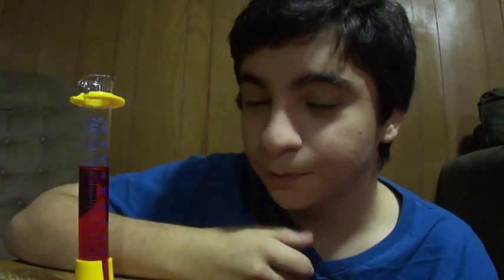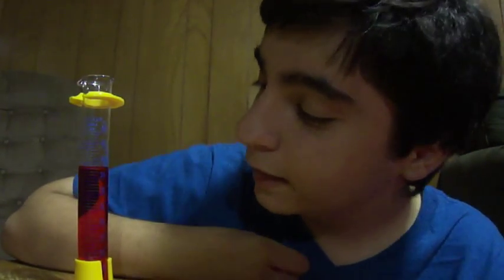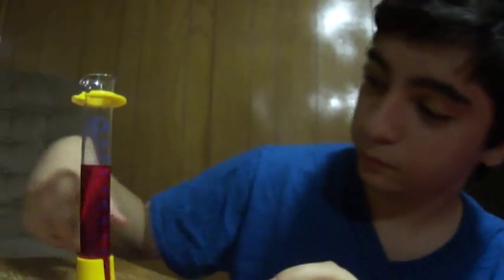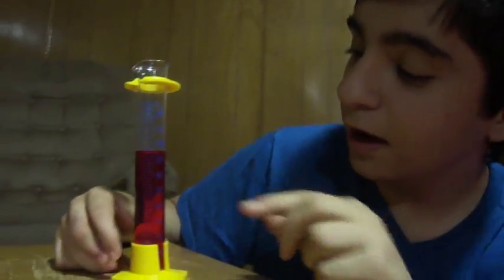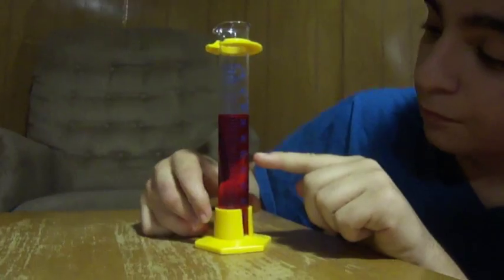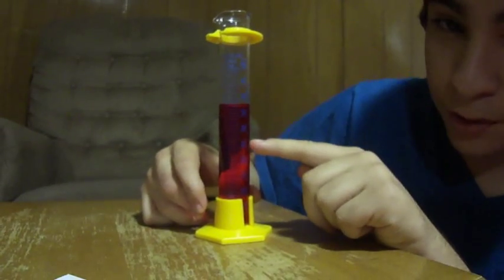Okay, before we can start to calculate the mass of this liquid substance, we need to learn how to calculate these ticks. So there's basically three kinds of ticks that we need to worry about on this graduated cylinder. There's the obvious ticks, the ones with the numbers and the longest ones. There's the medium ticks that are slightly shorter than the longer ones, and there's those ticks that you can't see but you can estimate, which is what we're going to need to do if we're chemists, which we are because we're in chemistry.